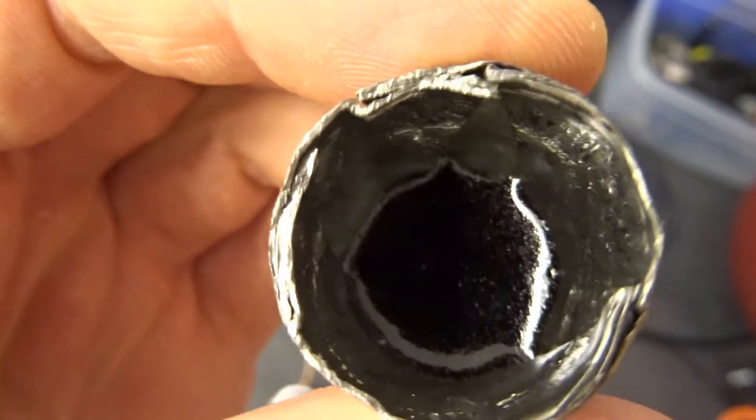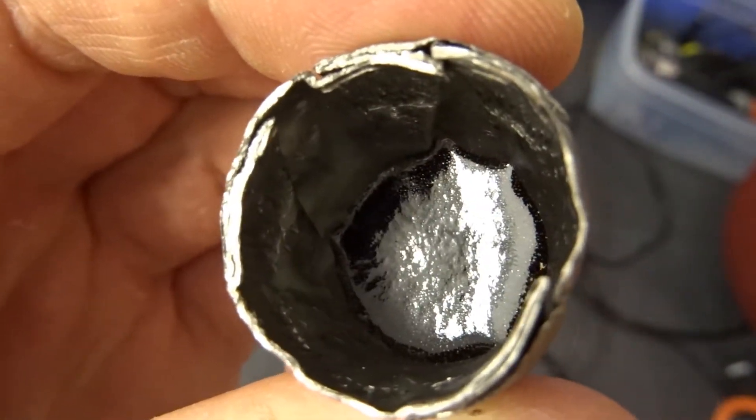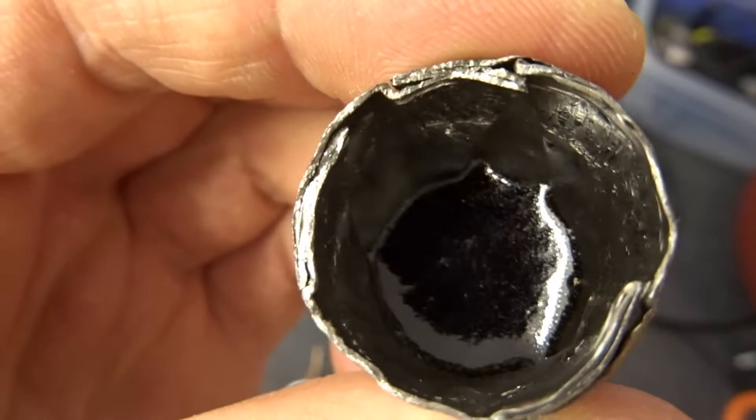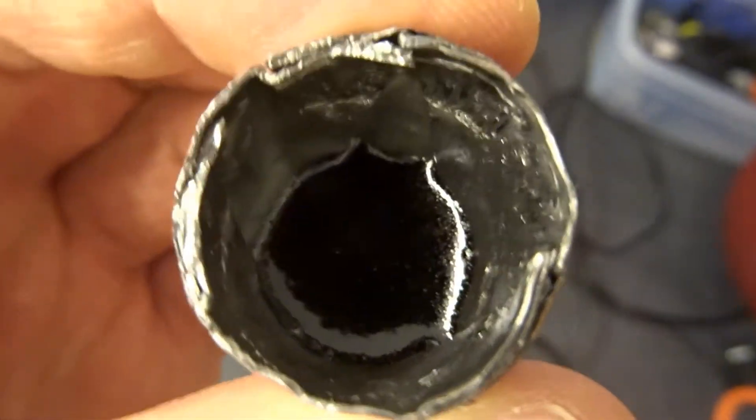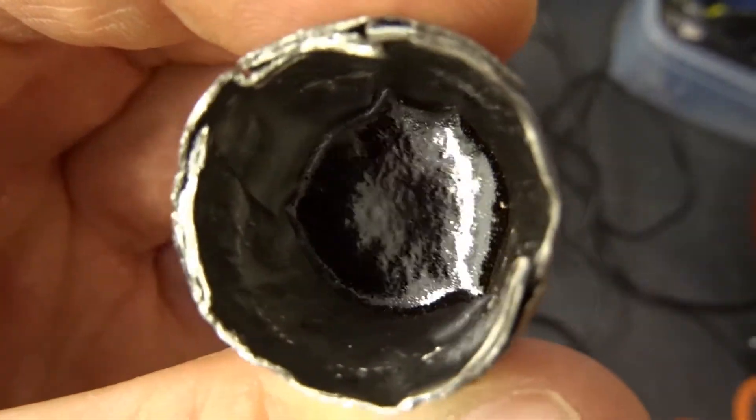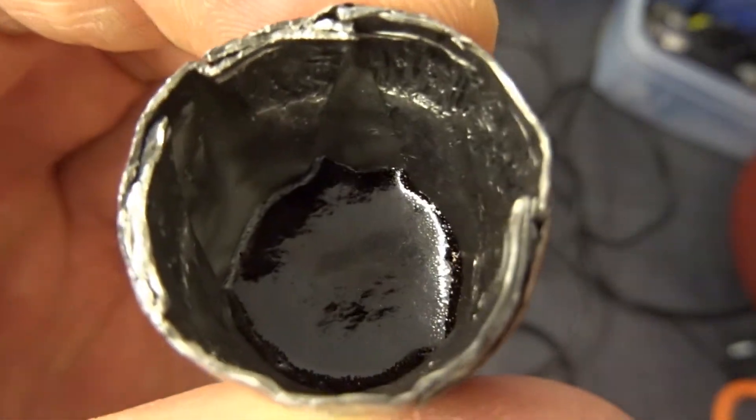So the first one I showed you was at around 130°C. Not quite enough. This one went up to exactly 150 degrees Celsius at 6 bar pressure. Fantastic. Really fantastic. Really fantastic bakelite.